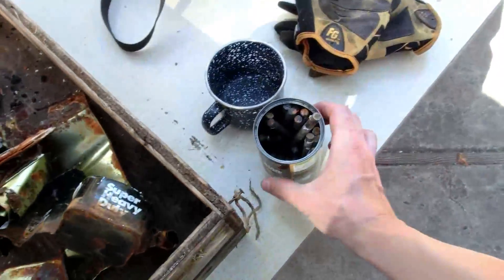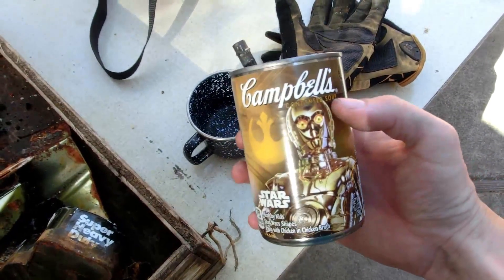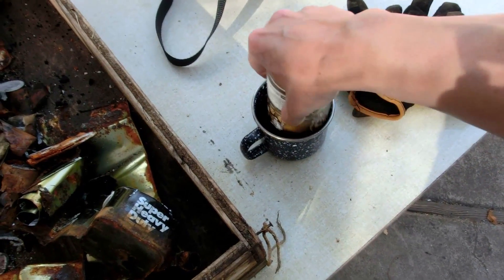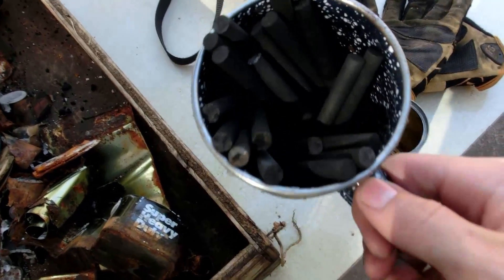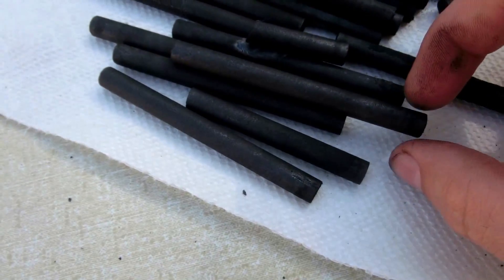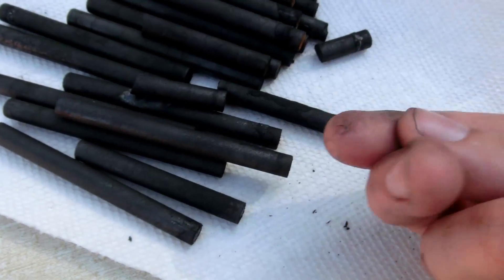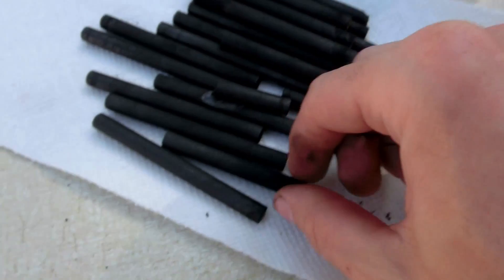I would say I'm done, and now I have 20 graphite rods — in the soup that I only got because it had Star Wars on it. Here are the graphite rods; I washed them off so they're nice and clean now. They're pretty nice.